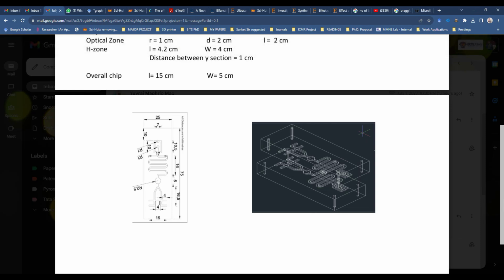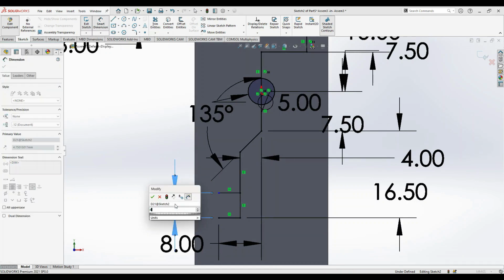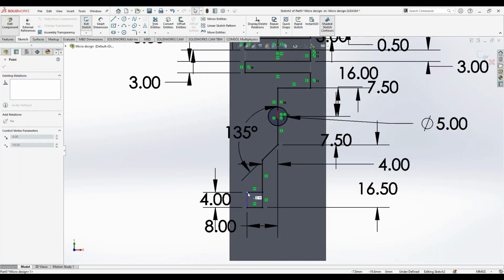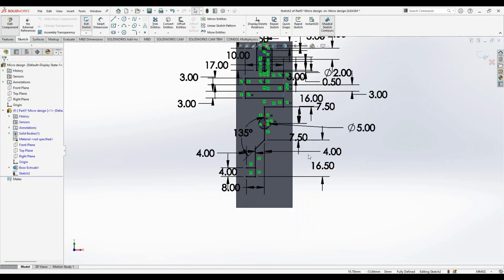and then we just have to specify the final gap between these two. So gap we maintain as 4. Then we just have to constrain this one line. We can just press this, or we can give a length of 4 mm. Okay, now everything is constrained.